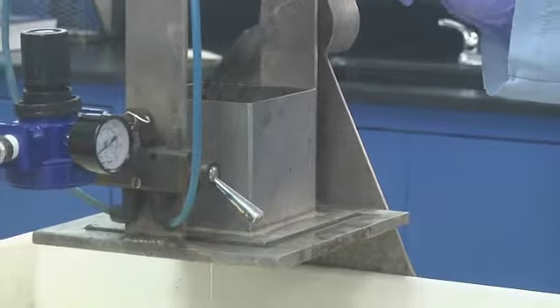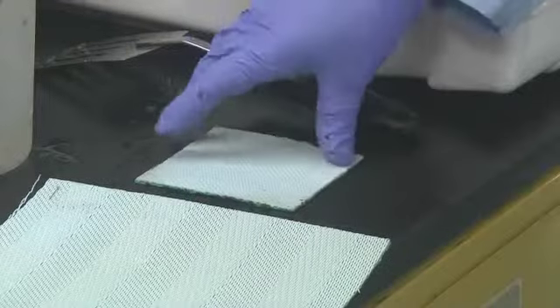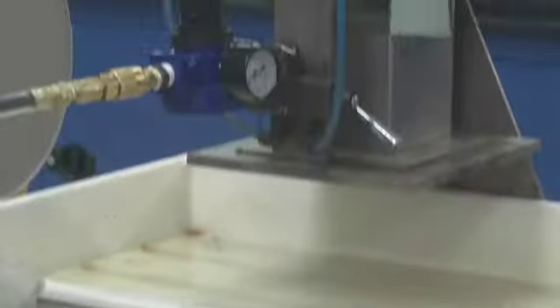A spatula is used to simulate the rolling action applied by the plows in the gravity zone. The time for the gravity zone and wedge zone is determined from the belt speed and the dimensions of the belt filter press being simulated.